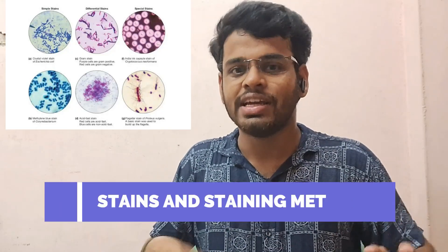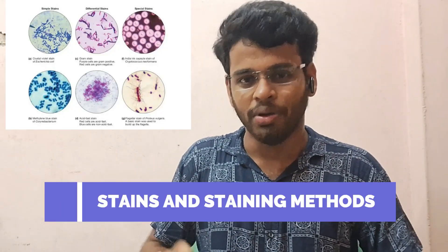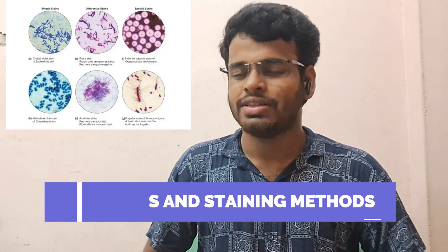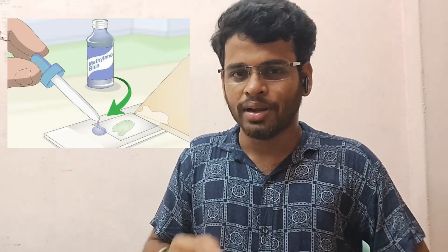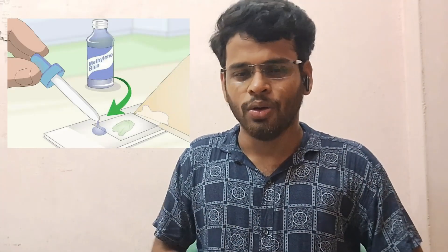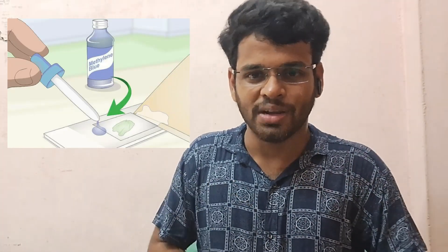Hi friends, today we will talk about Stains and Staining Methods. Staining is done in the lab. It's very easy.